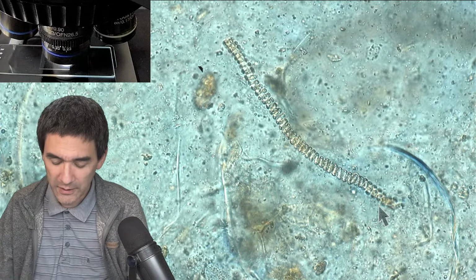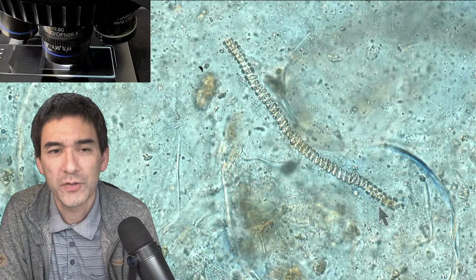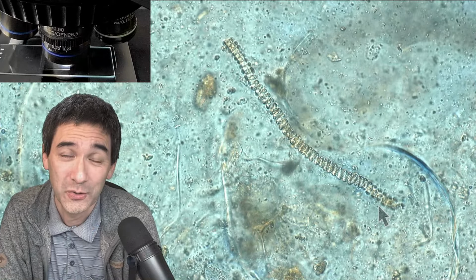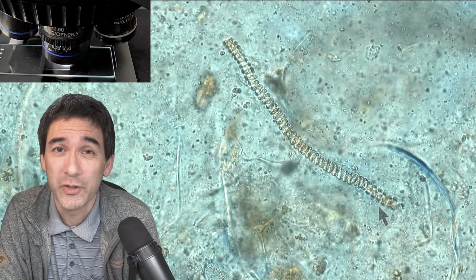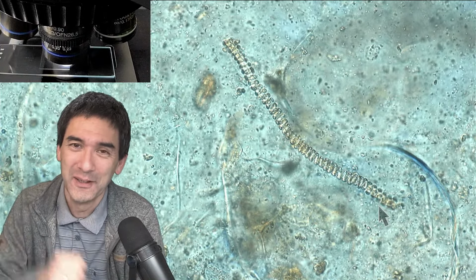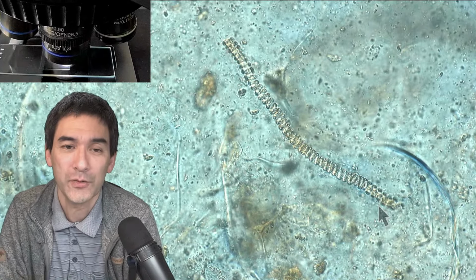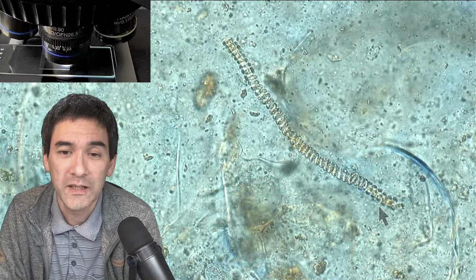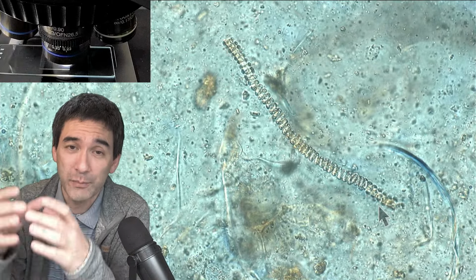I don't know if you watched my stream last week. If you watched my stream last week, I put some horse poop under the microscope. One of my students took some horse manure along because she was doing an experiment checking for parasite eggs, and thankfully I could take a small amount home for microscopy for the live stream. And if you put horse manure under the microscope, you're also, of course, going to see quite a few of those.